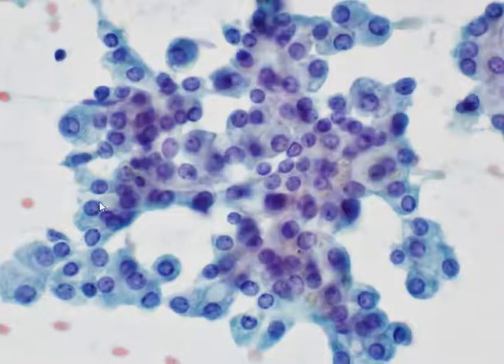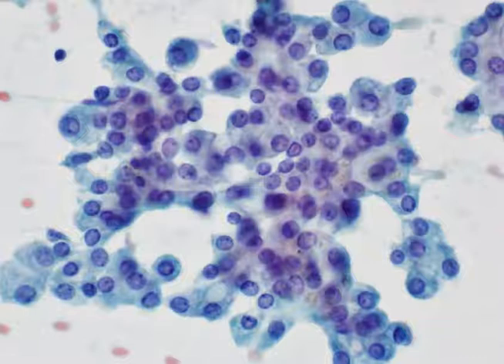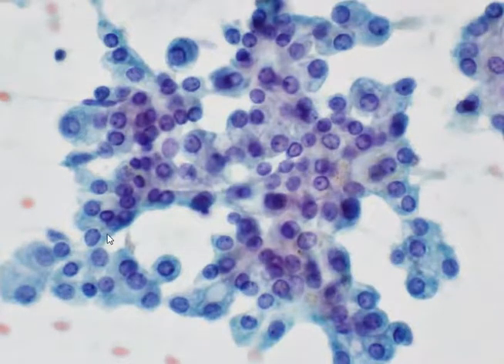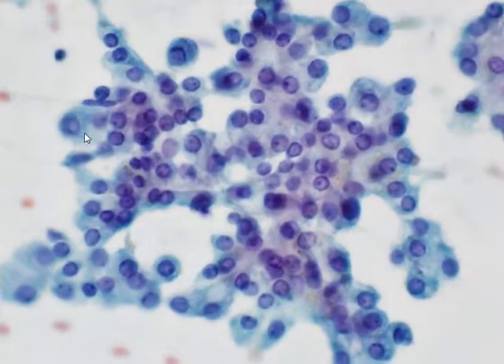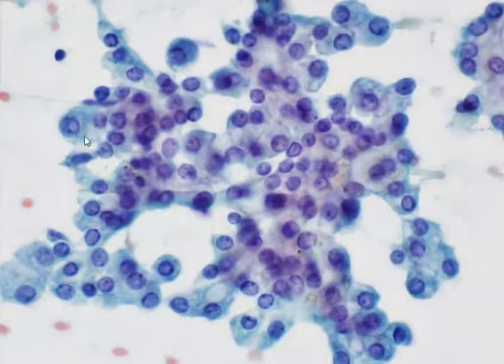On very high power, you can see again how round the nuclei are, and that they are relatively uniform and show these very small but prominent nucleoli.